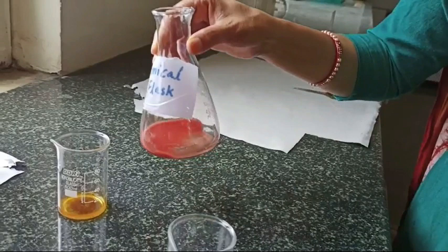Here you may have a question: how we come to know that it stops changing the color? So here actually when we are adding the drop of AgNO3 to this solution, that drop at the middle of the bottom of the conical flask will not show any visible change. So that was the end point.